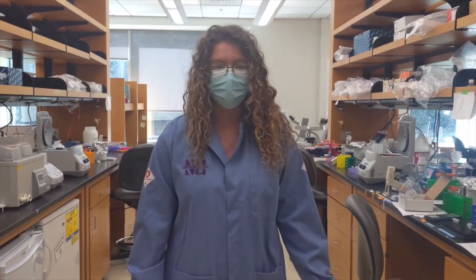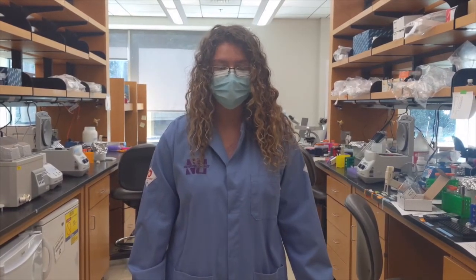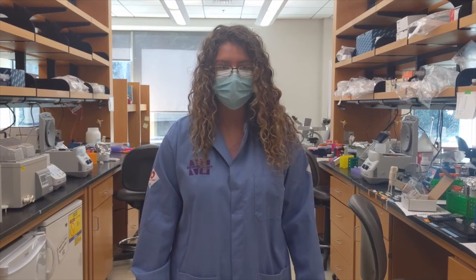My name is Ellie and I'm a graduate student who studies developmental biology. Specifically, I make movies of the fruit fly embryo as it develops. Let me show you around.